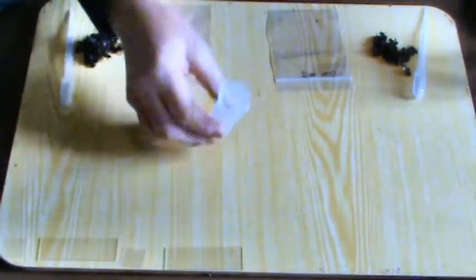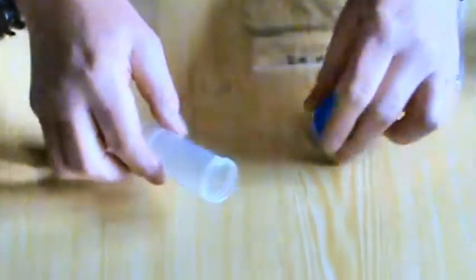You can collect them in a little tub like this with the screw top, holding it at the front of the entrance and just knocking the bees in until you have it full and then screw it in.